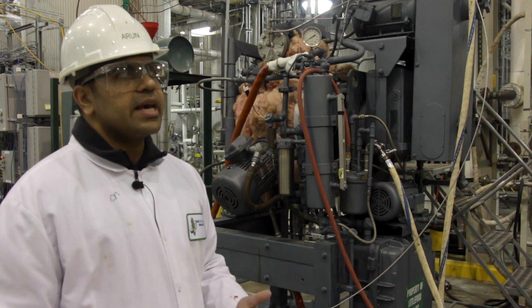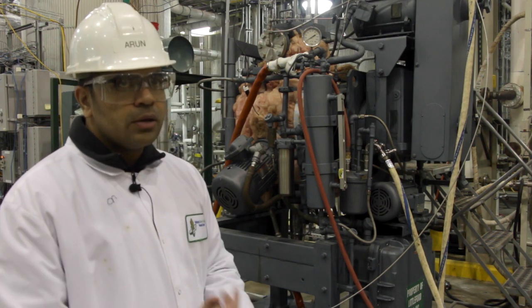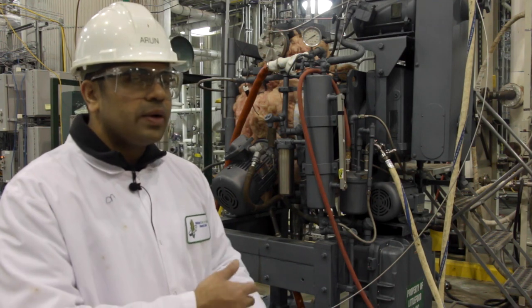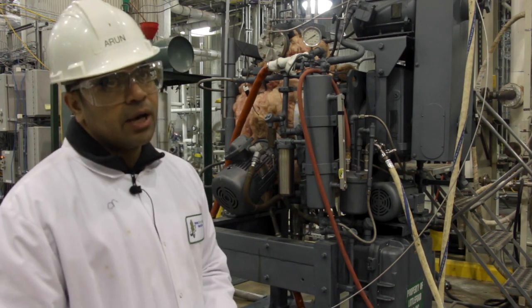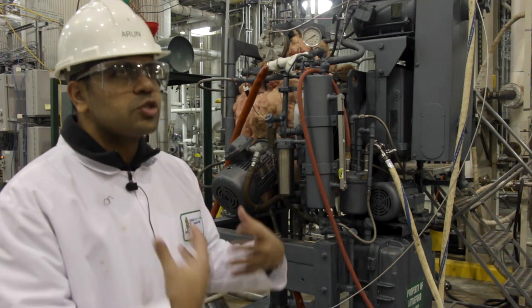What we have is a slurry, which is made up of corn stover and a lot of ammonia, and all the components of the stover that were dissolved in the ammonia. We need to remove that from the rest of the material, which is what we are after.